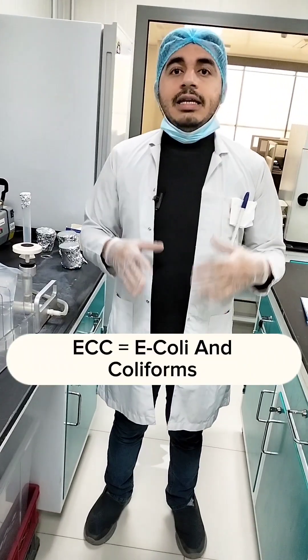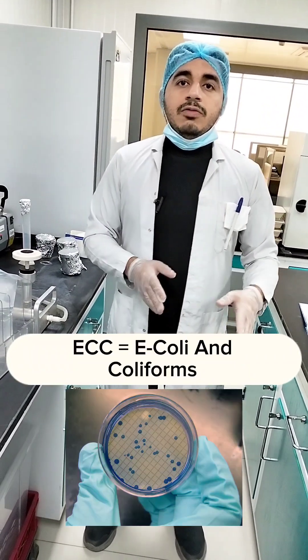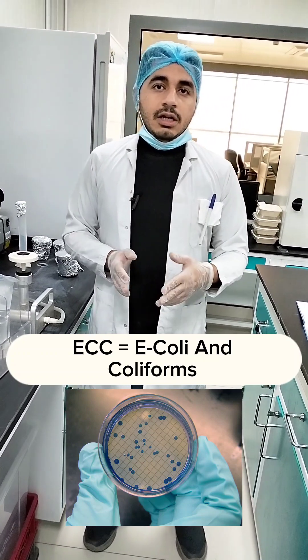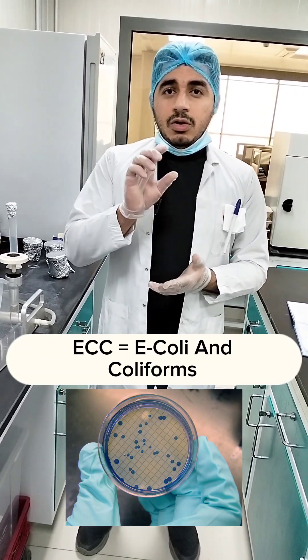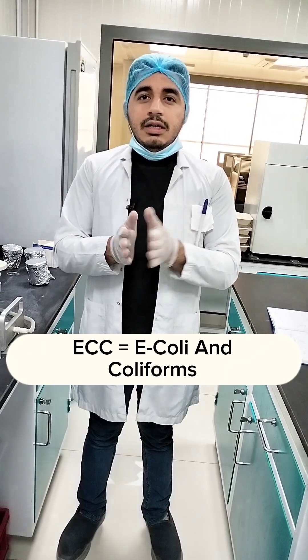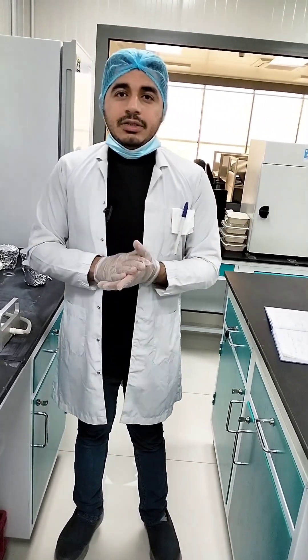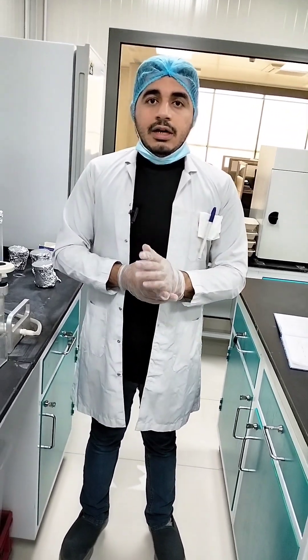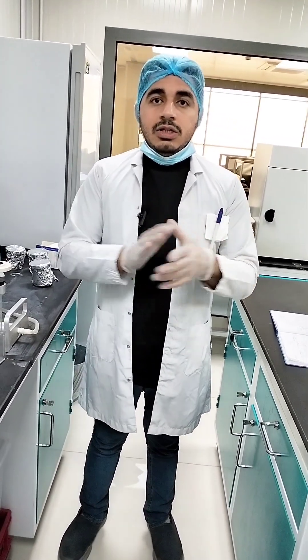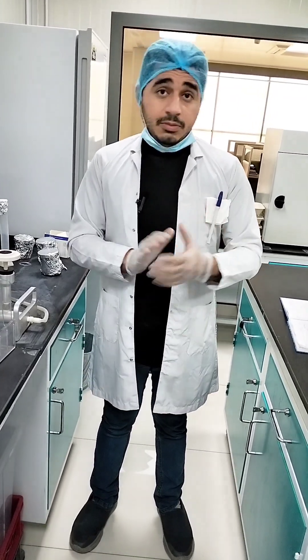E. coli and coliform are present in the human and animal intestine. The presence of coliform in water samples indicates that your water is contaminated by some organic and fecal contamination, and it also indicates contamination by deadly pathogenic bacteria which can cause severe food poisoning in case of consumption.